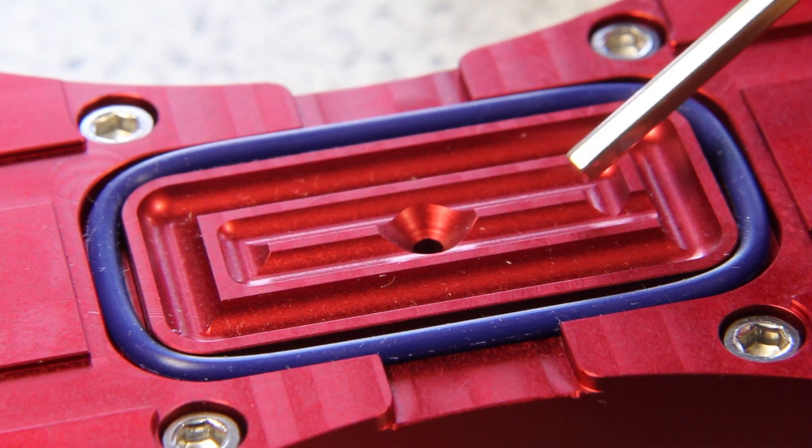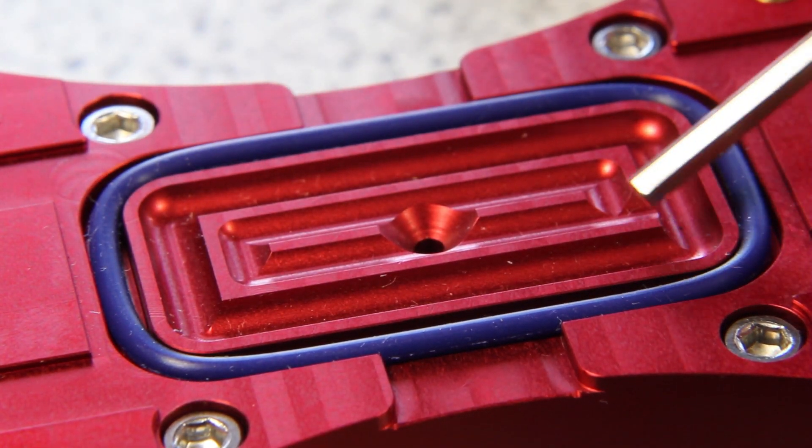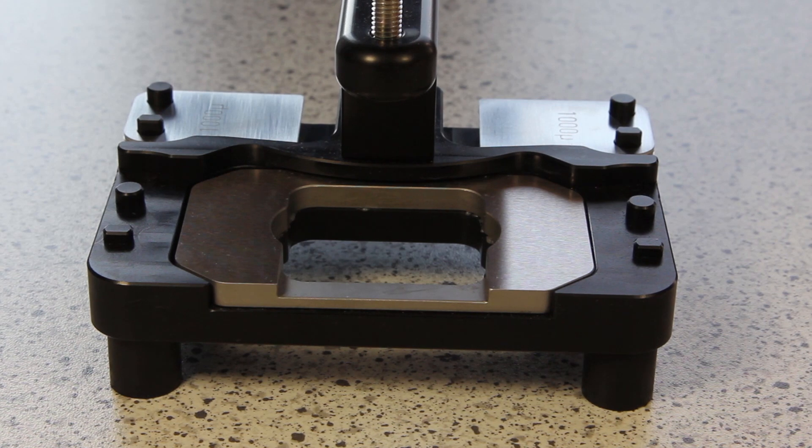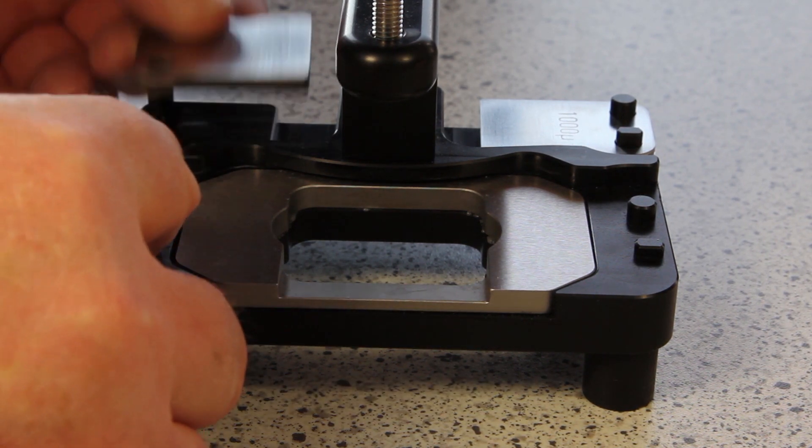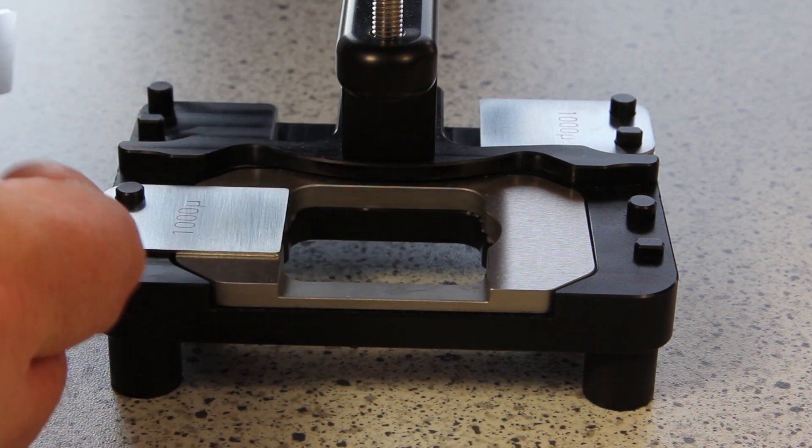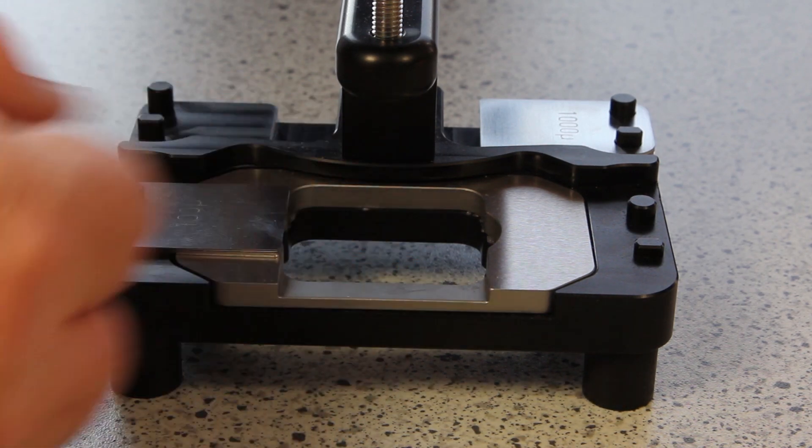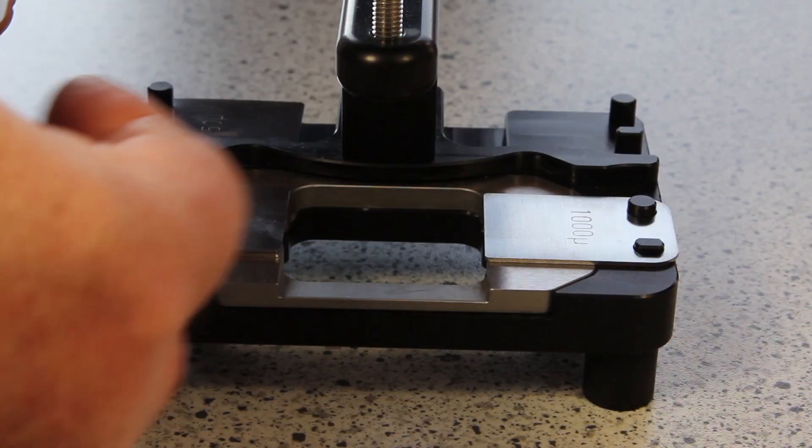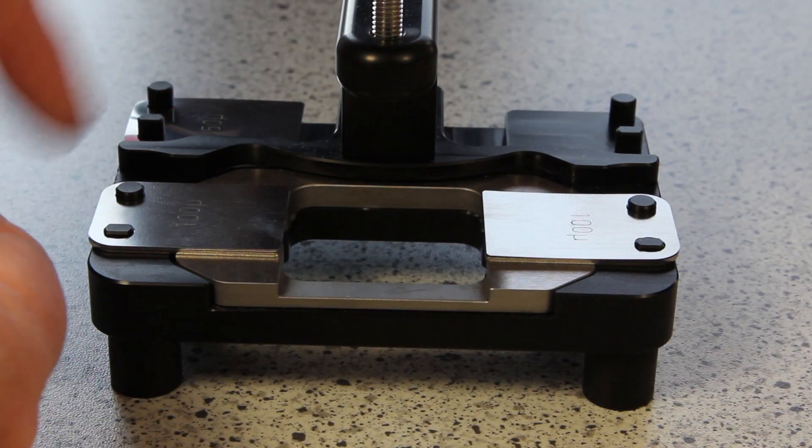Make sure that the blue seal is in the groove all around. This slide has to touch this surface. That's why you have to make sure that there is not any dirt on it. Now I adjust the mouse for grinding thickness of 1.4mm. Therefore I put on both sides 1,000 microns, 1,300 microns, 1,400 microns. On this side too, that's 1,400 microns.